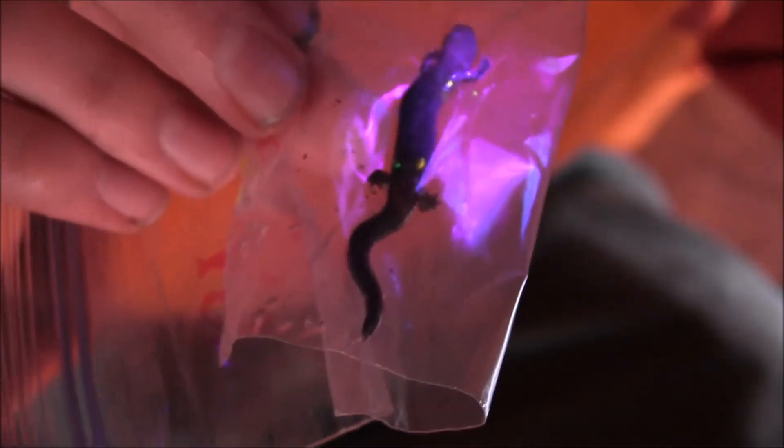So, all in all, I'd say a successful mark. The marks aren't too big, but they're not too small that are hard to see either.